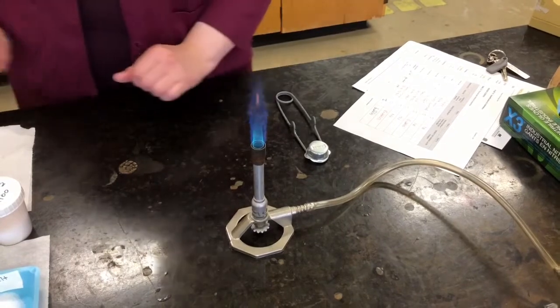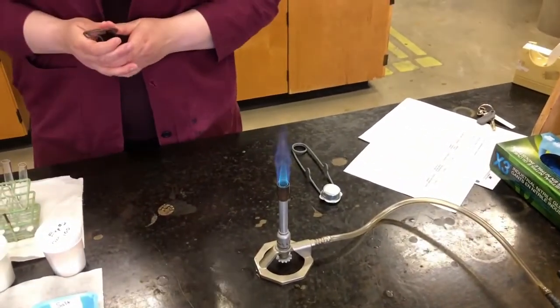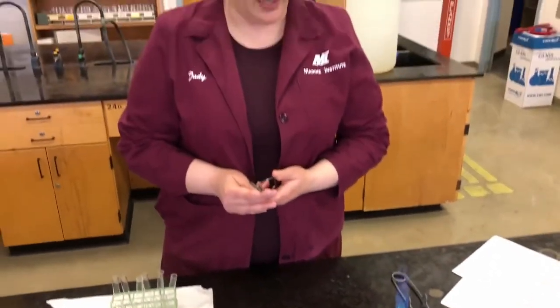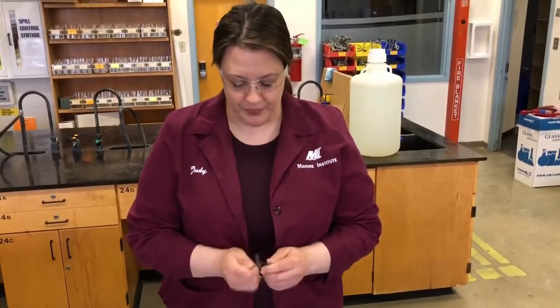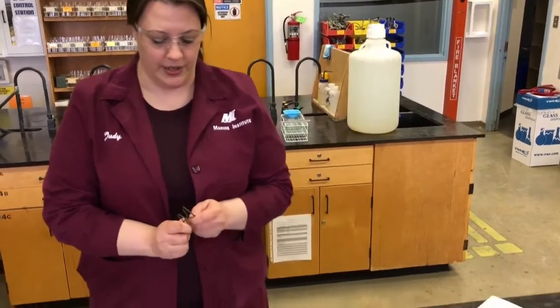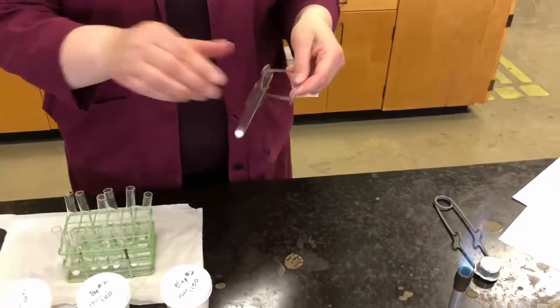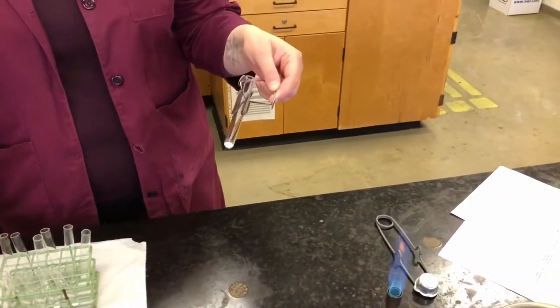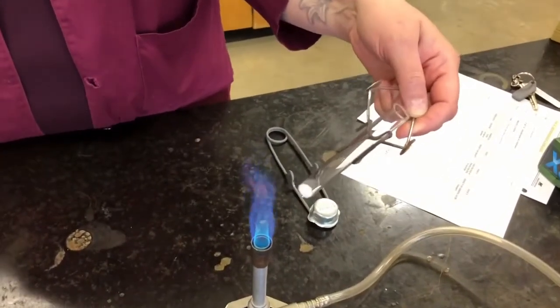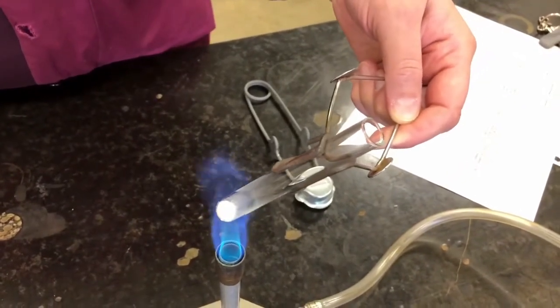Okay, so when we put our samples in the flame, I'm going to put them in the position that is most effective for heating, if you remember from the previous video, which is at the tip of that inner blue cone. I'm going to use a test tube holder to hold on to the test tubes, because of course I don't want to put my hands in the flame. So I'm just going to take the sample, and the first one is salt. I'm going to hold it in the flame. Now this one, we may not see anything happening, but we might hear something. So listen closely.